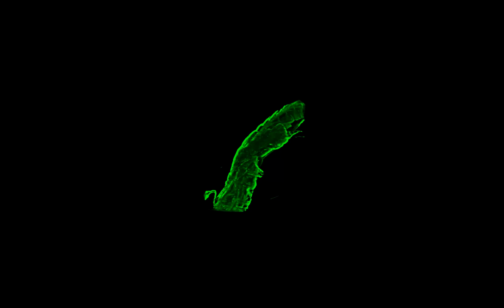So here we are at the end, our efforts rewarded with this nice little rendering of a portion of the brine shrimp. I reacquired this with the exposure time twice that I had in the video, and then deconvolved the image so that I could render it in 3D with a reasonable result. Because my screen capture software seems to compress the video significantly, I stepped out of ZEN for this slide and embedded the data directly. You may have noticed the images appeared pixelated in the tutorial at points.